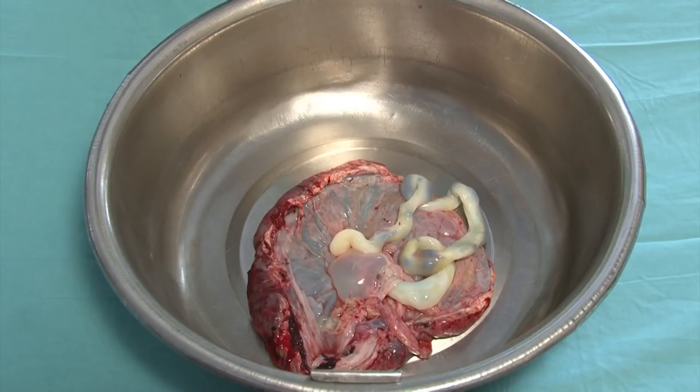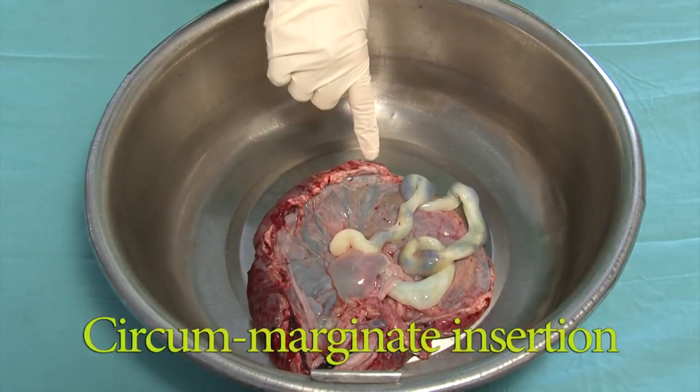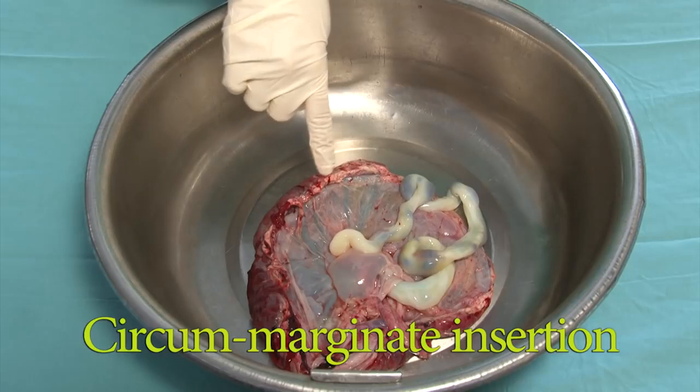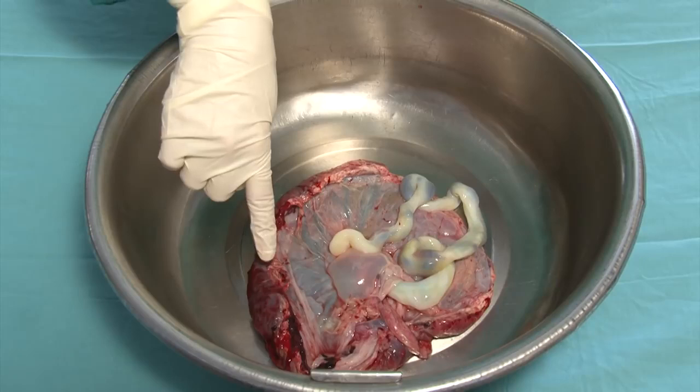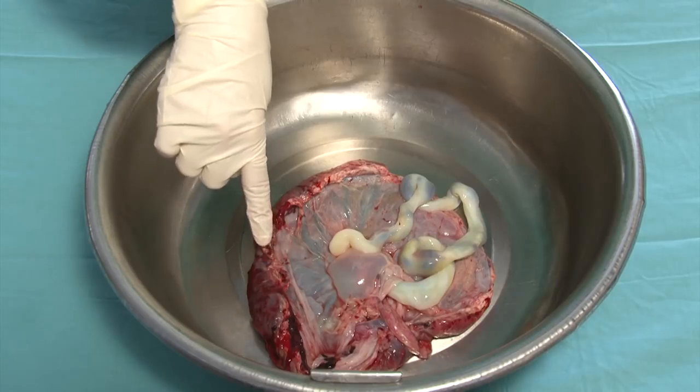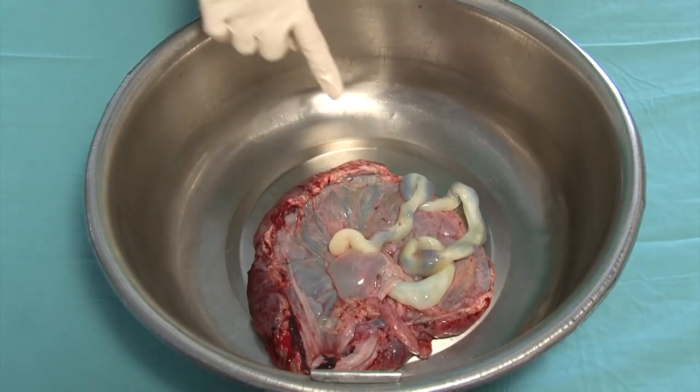Here is a placenta with an abnormal location of the membranes. The condition is known as circummarginate insertion, which is identified by the membranes coming off the placenta before they reach the margins of the placental disc. The condition is not associated with any adverse outcome.